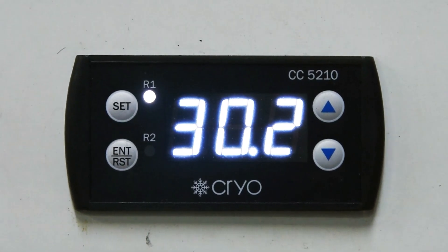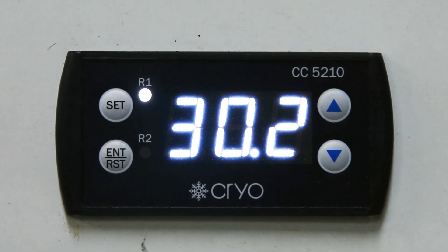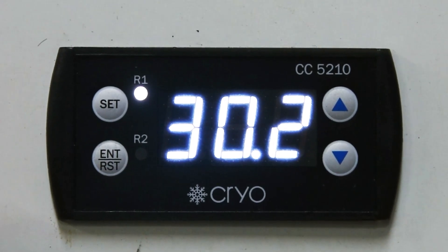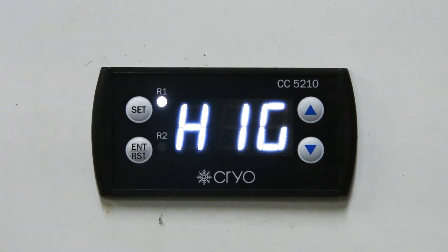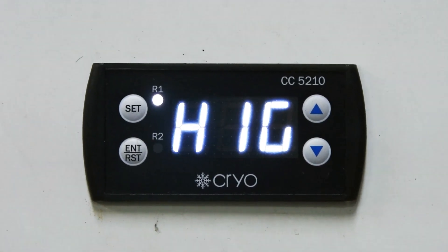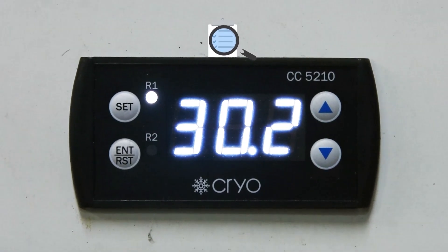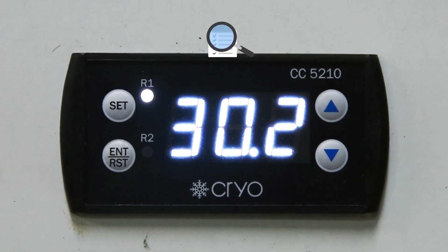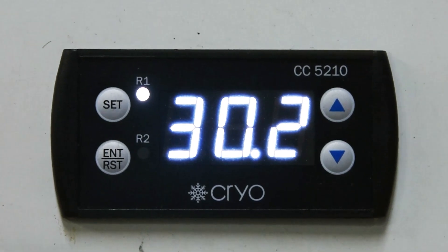All controller settings are already set by the factory, so we do not need to press or set any key in the field. However, we can check or cross-verify the parameters if we have any issue with the cooling.